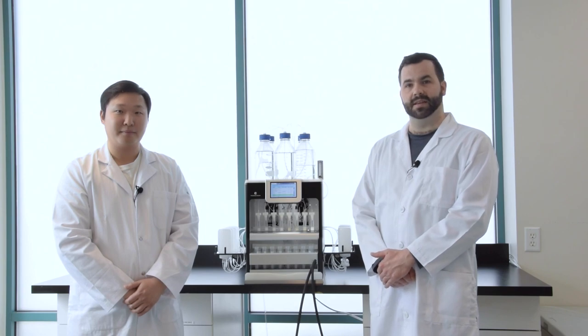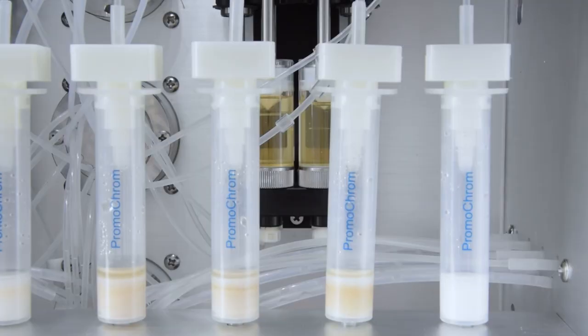I can see that the rinsate is now being drawn through the inline filters, which means for the final rinse with the elution solvent, we can recover the trapped analytes. That's the idea. If necessary, the SPE03 can even push the rinsate through the filters again and draw it back to further recover any compounds that are highly adsorbent. The system is now pushing all the rinsate through the SPE cartridges.